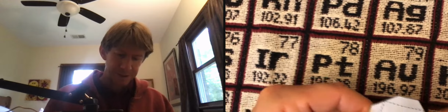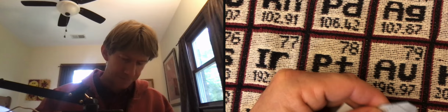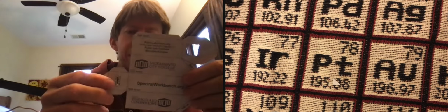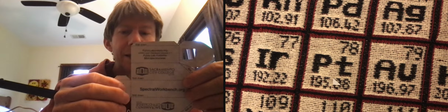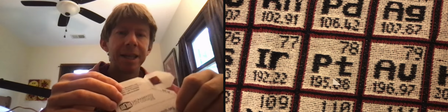My construction is not that great. And actually, I think I'm gonna cut it a little longer. Well, actually, I'm just gonna stick with that. So without an X-Acto blade, that's actually not too bad. So now I've got my piece here and I've got my cutout window and I've got a cutout. So the light's gonna enter here and this is gonna be our viewfinder. And now we're ready to fold it up.